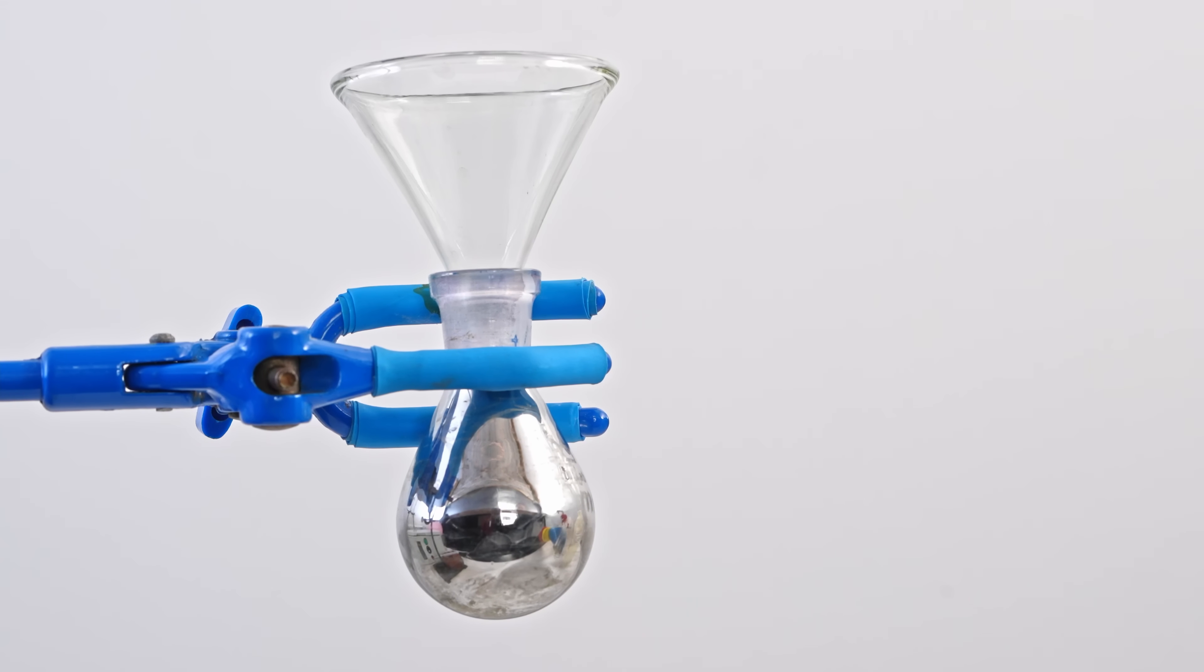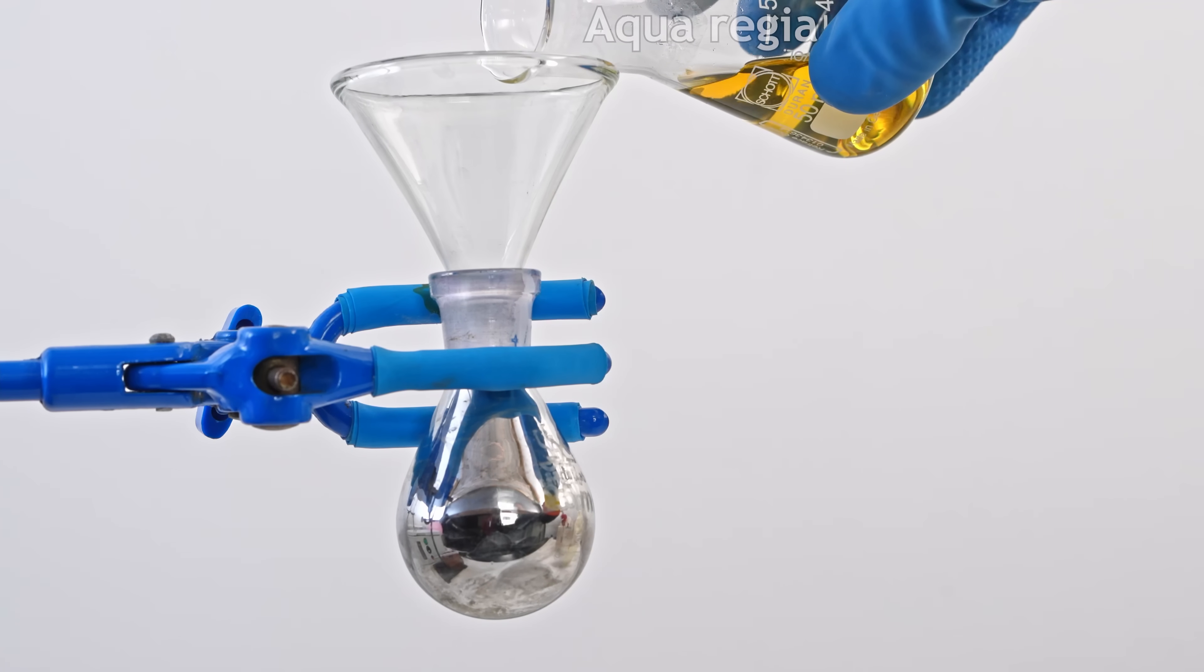This mercury mirror can be easily dissolved using nitric acid or aqua regia.